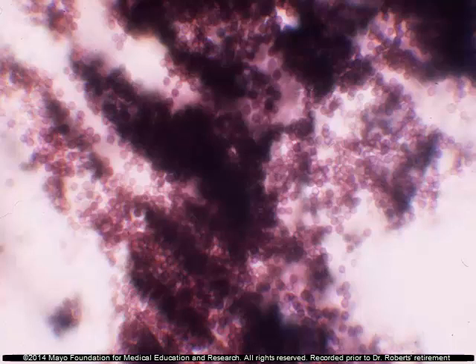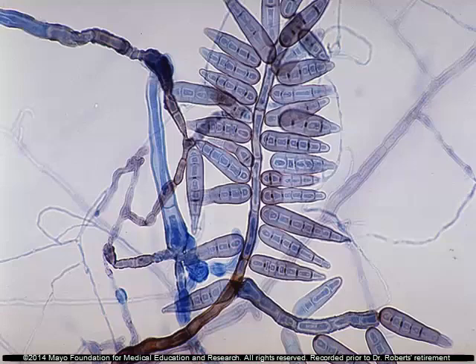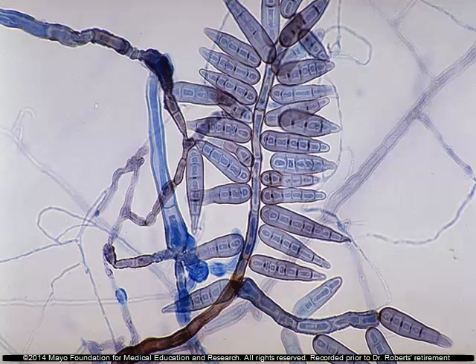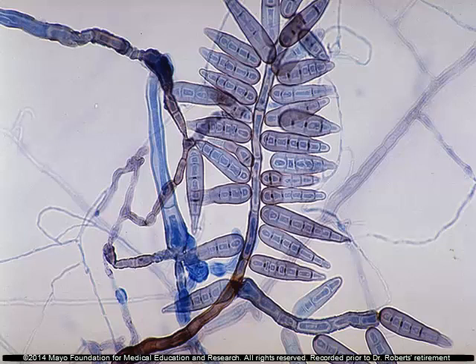If you take the prep from the center, you see all these spores and it's difficult to see because there are so many of them. What you need to do to make a good mount is to sample from an area in between the outside advancing edge of the culture and the center. This is an example of what you would like to see — an organism with all the spores attached just as they were growing. The scotch tape prep allows you to see the spores attached just as they were in the culture, so you can see exactly how they're produced and what they look like.